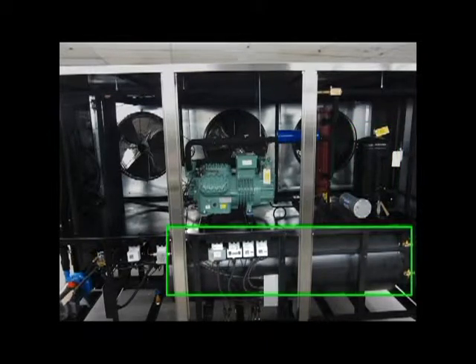This particular chiller has two tanks, each of which has its own coil. All tanks are stainless steel with stainless steel coils. They are insulated and covered with an outer metal jacket to hold the insulation in place.